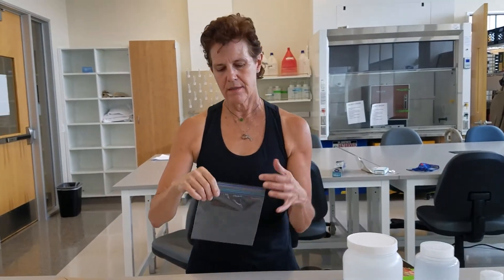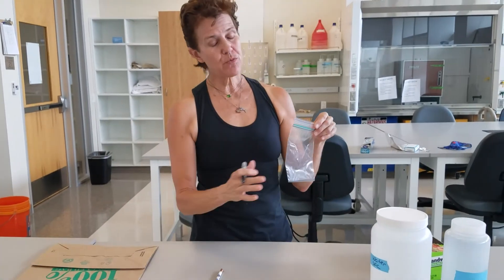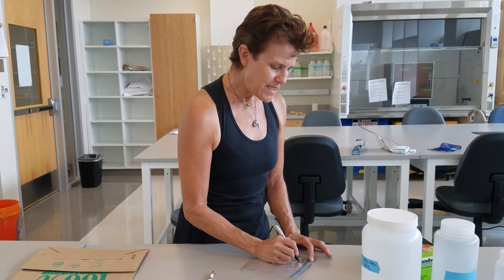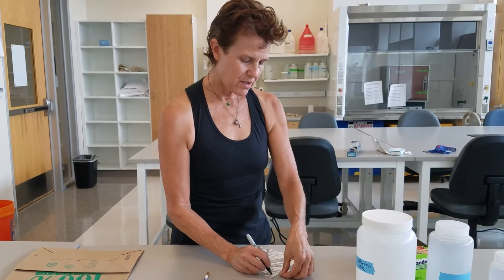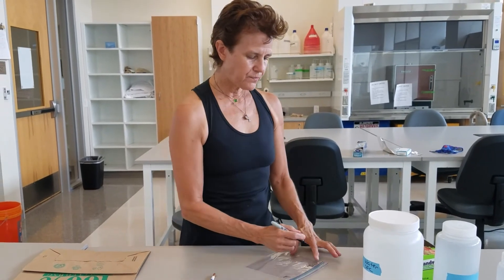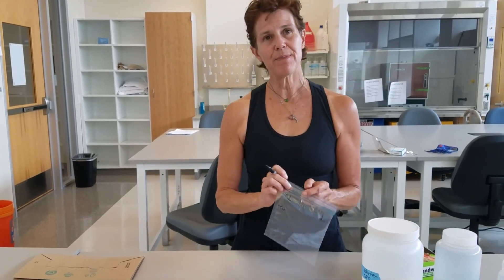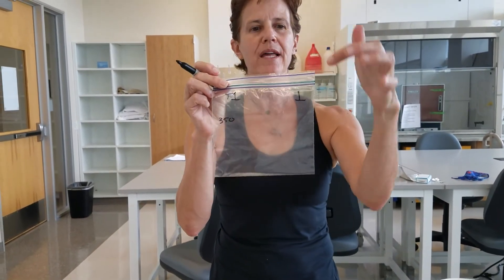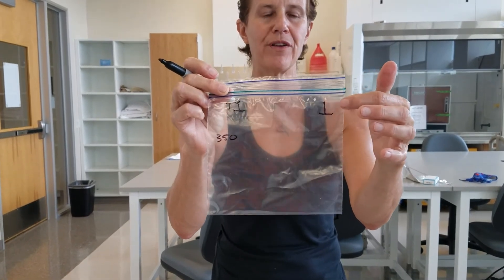We use plastic bags for collecting soil. The way we set things up in the wetland is with transects, so I start with just the transect number and then the sample number — just in case somebody else wants my soil. I put '350' on the bag, then the transect number, and then the sample number, which will usually be a number from 1 to 15.